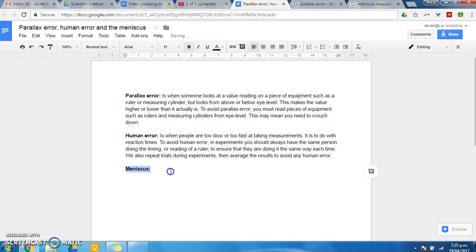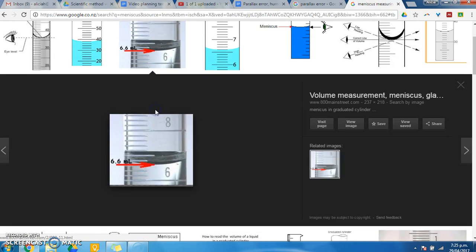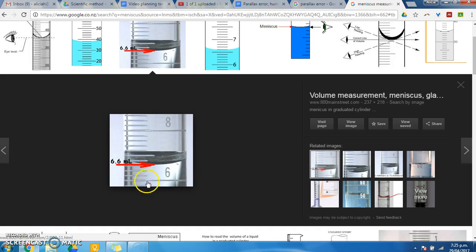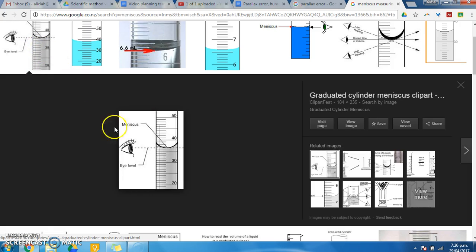Finally, the meniscus. The meniscus is something that you need to worry about if you're talking about measuring liquids. Again, if you Google meniscus, you'll be able to see what it actually looks like. The meniscus is on any liquid, the lowest point of that liquid. Well, that's the negative meniscus anyway, and that's the one you're most often going to see. If we look at this image, we can see that this person is trying to avoid parallax error because they're standing at eye level and they're looking at the base point, and that's where they're going to take their measurement from. Here's another example here.